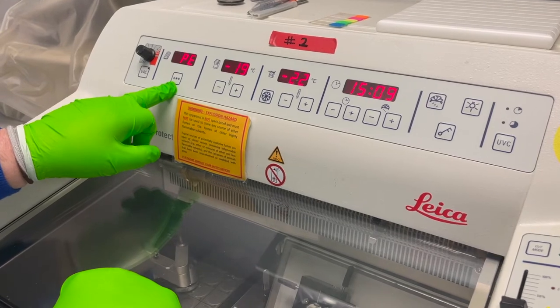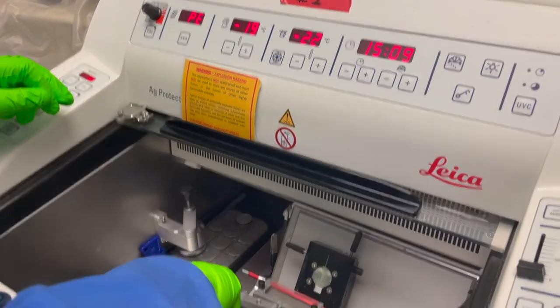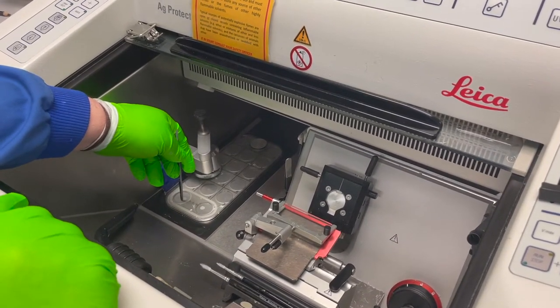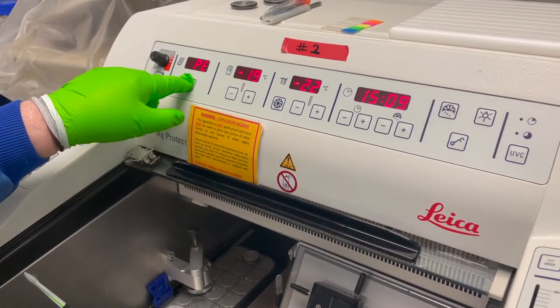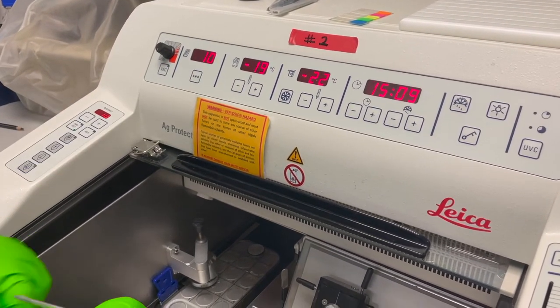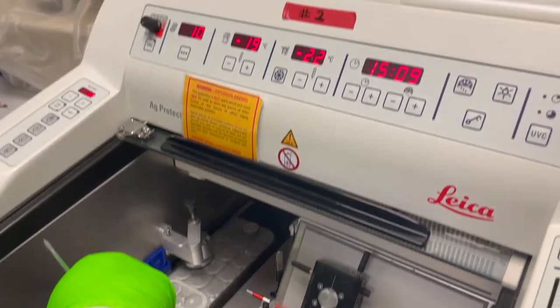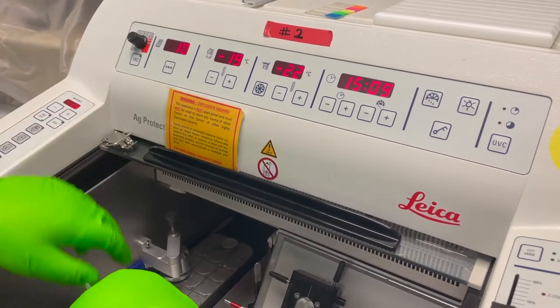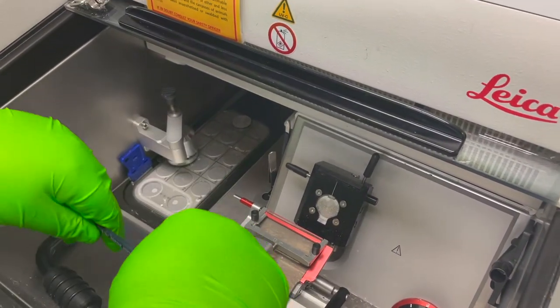Next up is PE — that's Peltier effect. That's for these two cooling spots, and it's on a timer as well. That will send these two spots very cold and will turn itself off. It is an independent chilling system to the rest of the cryostat.